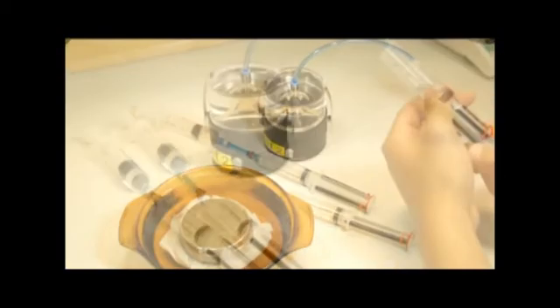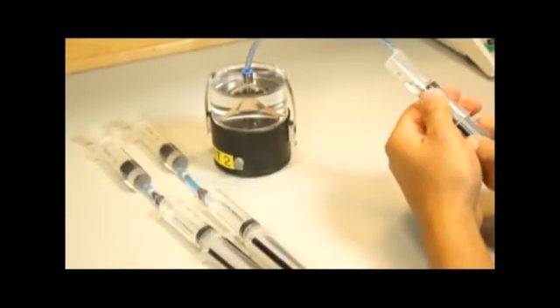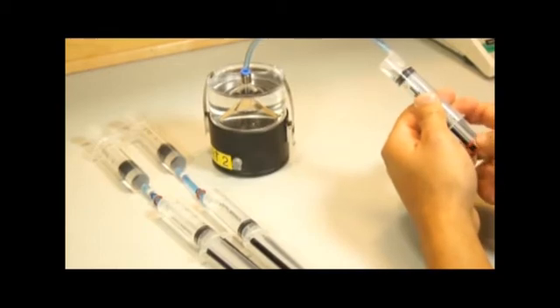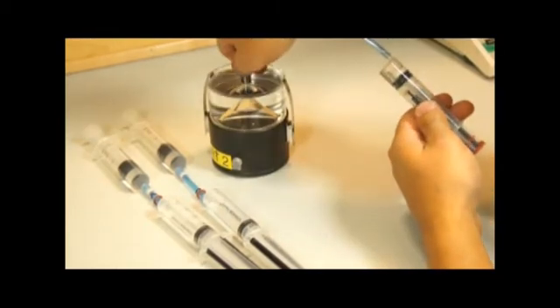The next day, take the tension off the degassing chamber slowly. If you move too quickly, the syringe can snap back and damage the pressure transducers. Check that there are no bubbles.